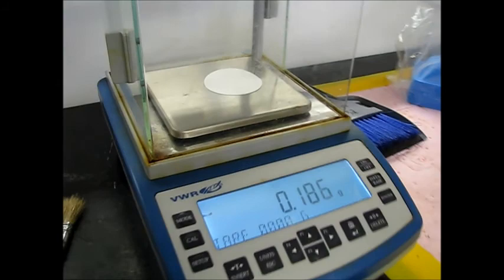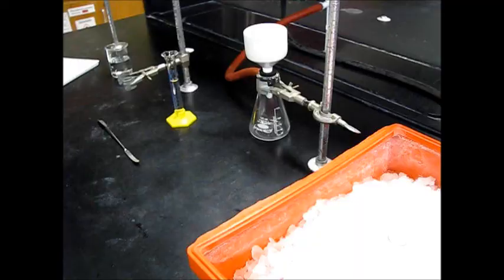So before we do this vacuum filtration, we want to make sure we remember to weigh out our filter paper. We've got 0.186 grams. So we'll write that down so we don't forget.